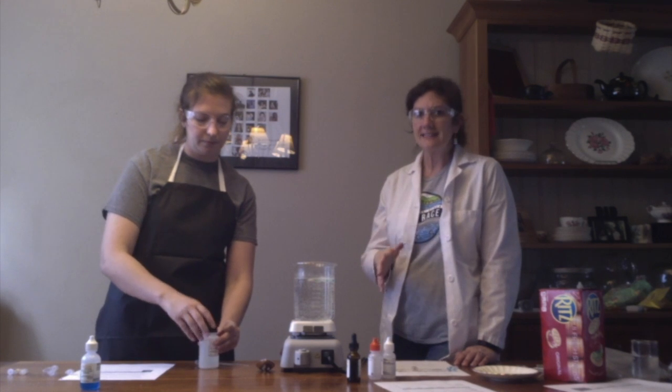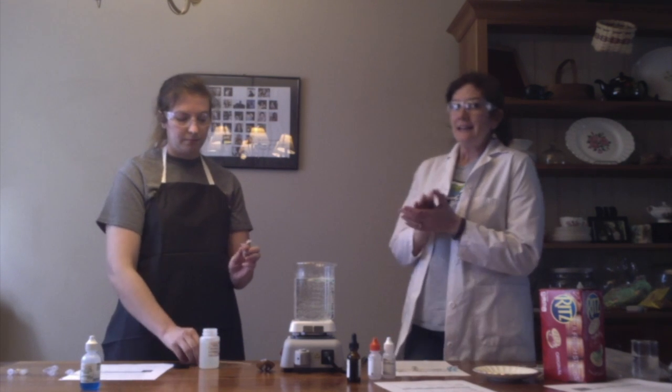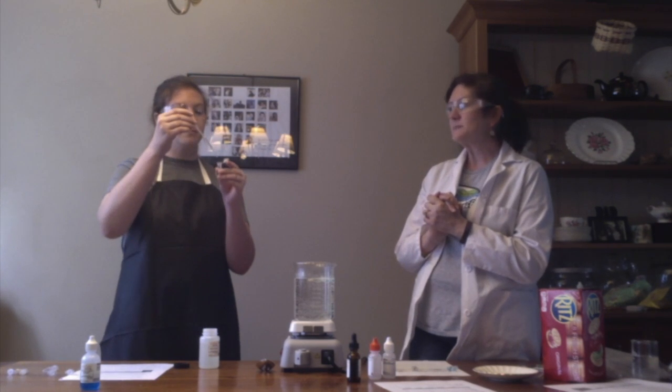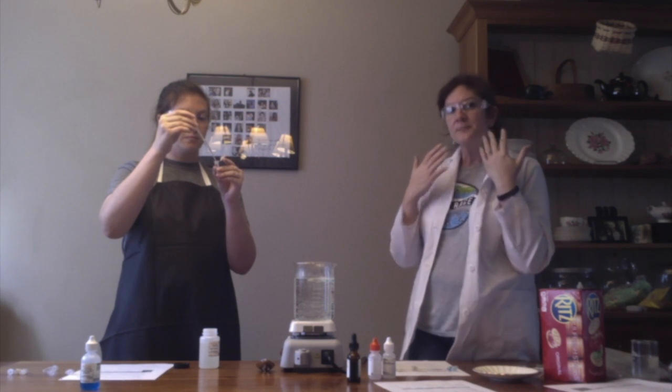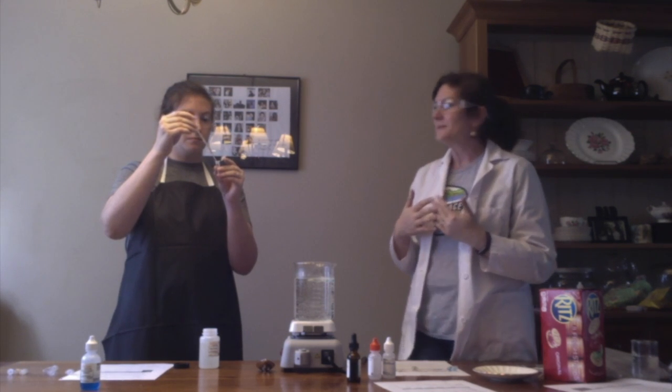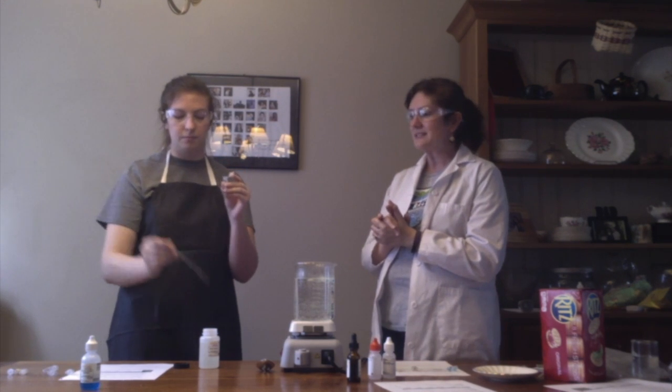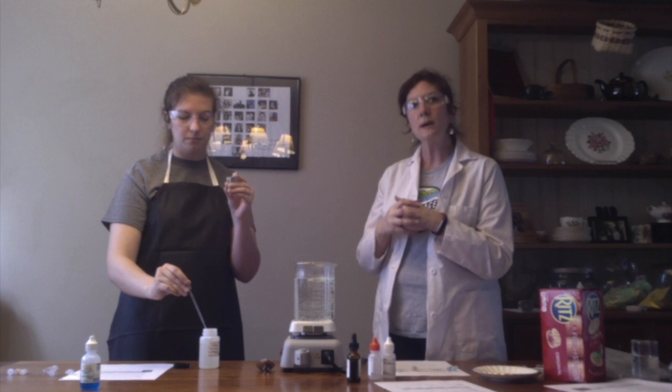So amylase is an enzyme. Now, enzymes can be found in our bodies. You may have heard about this before. Specifically, one place we find them is in our saliva, or in our mouth. This amylase enzyme did not come from our mouths, it came from a jar, but we're going to use it to simulate what would happen if you chewed up the cracker.